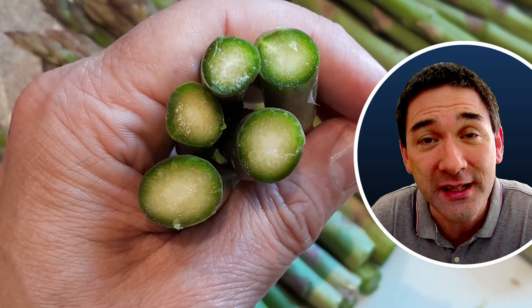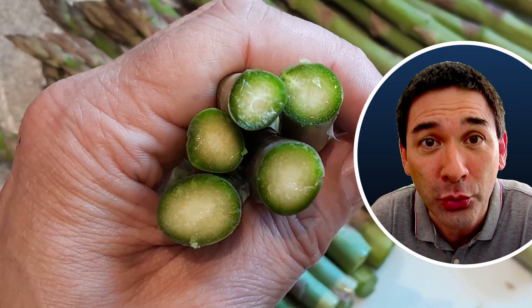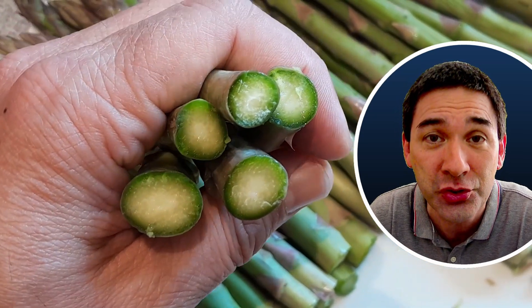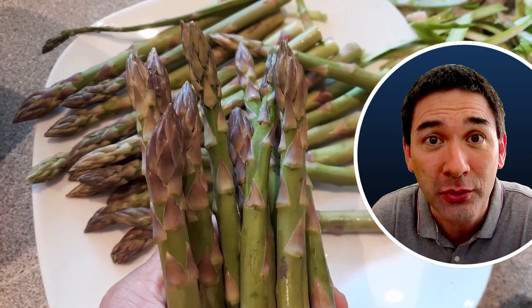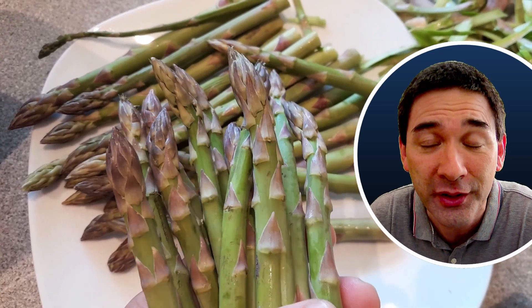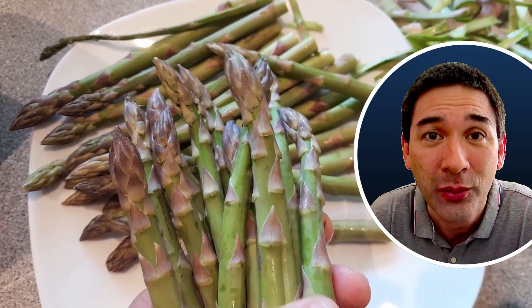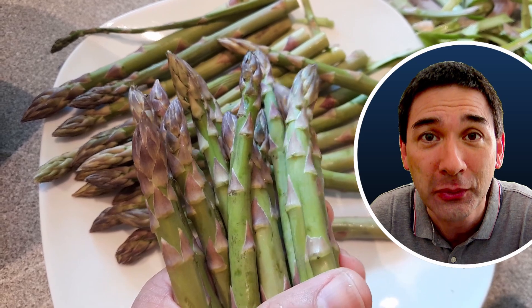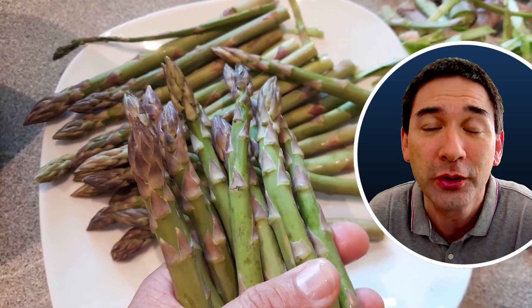The reason is because it is a so-called monocot plant, and by looking at the stem cross-section under the microscope we're able to see the typical arrangement of the vascular bundles of a monocot plant.